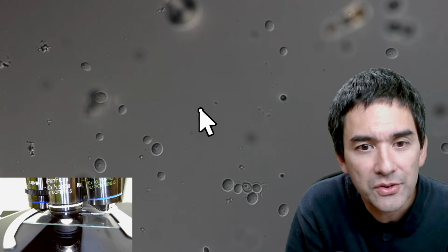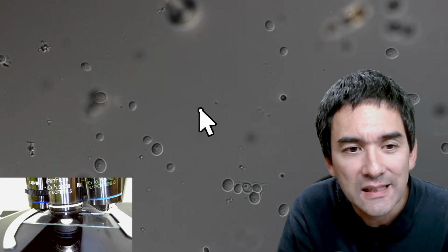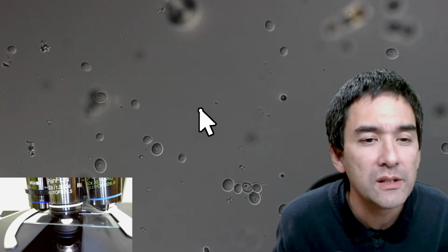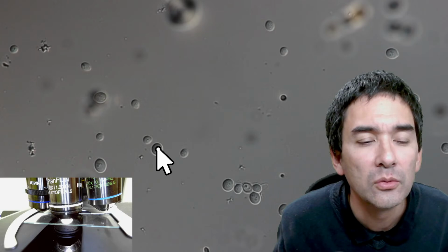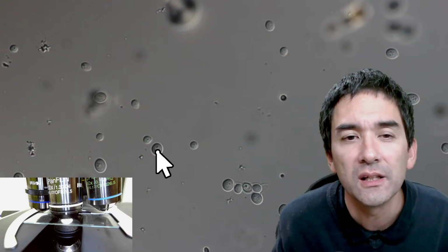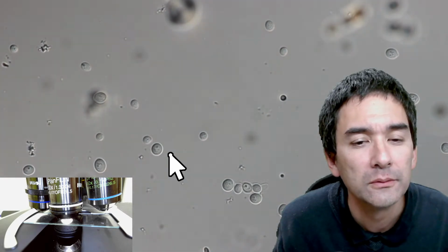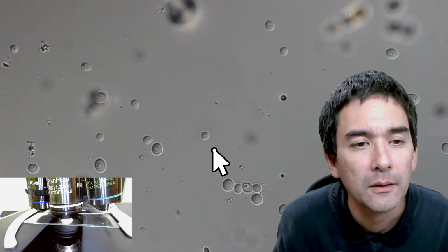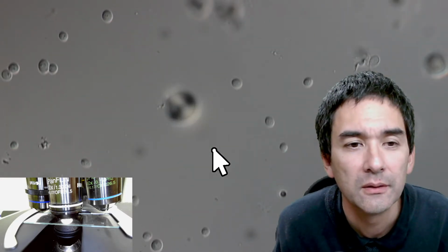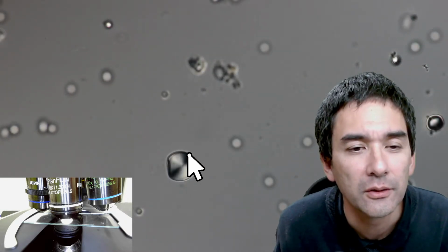You're going to see that you can actually see some structures and details inside the cells as well. Maybe I'm going to increase the brightness a bit here. If you look into one of those cells, you're able to see that there's something in those cells as well. Let's readjust here at the top. So it is indeed increasing the resolution quite a bit. I don't know what this round thing here is.